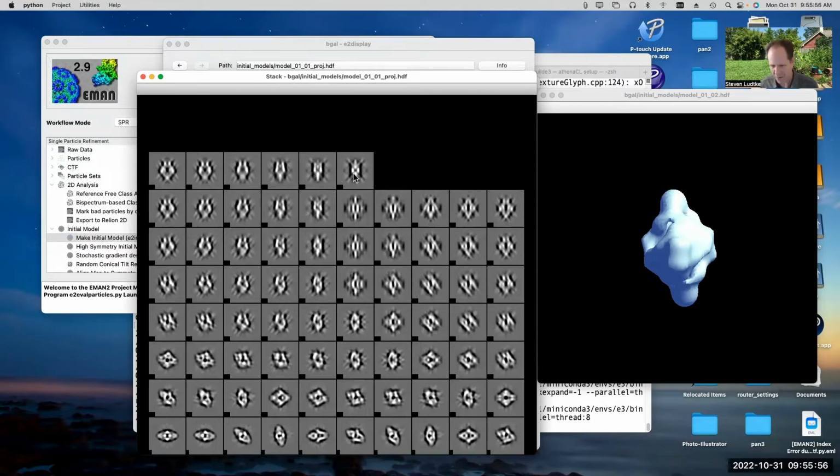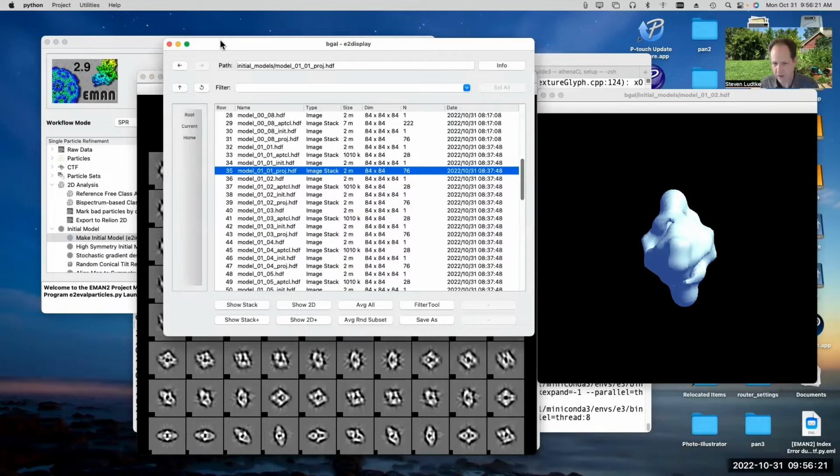But then when we get up here, we see all these kinds of artifacts and stuff in the projections. And what this means is we didn't really give it a complete set of orientations. So the subset of particles that I picked didn't have very complete coverage of the asymmetric unit. It was missing some orientations, and the way it arranged things, it came up with something which is just a little funny. So let's take a look at the second one, which I think looks better to my eye.